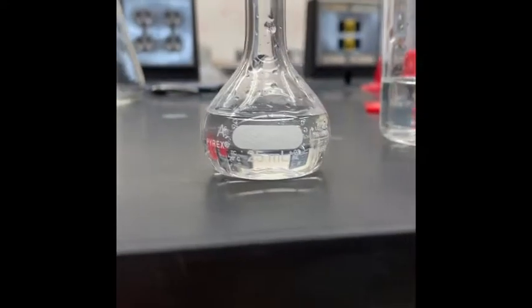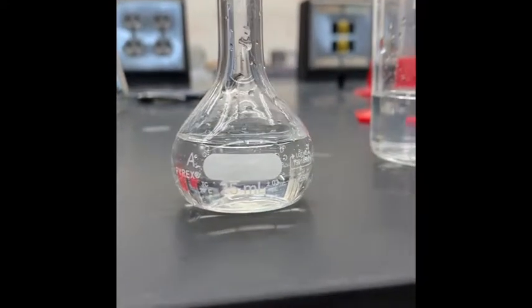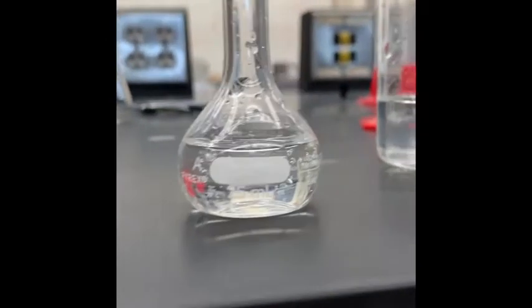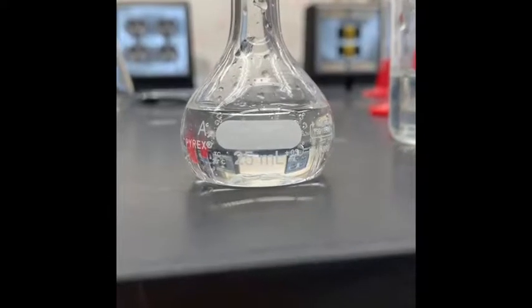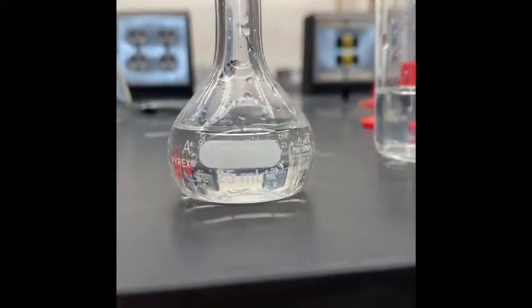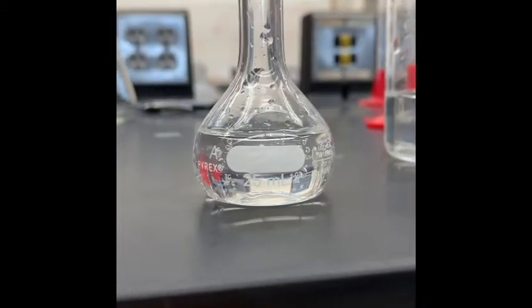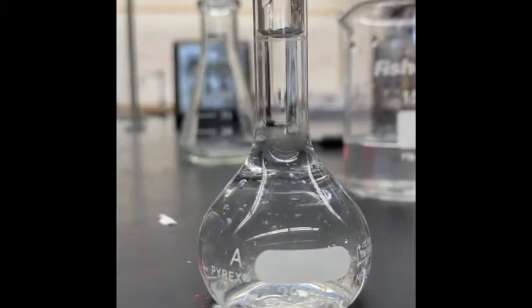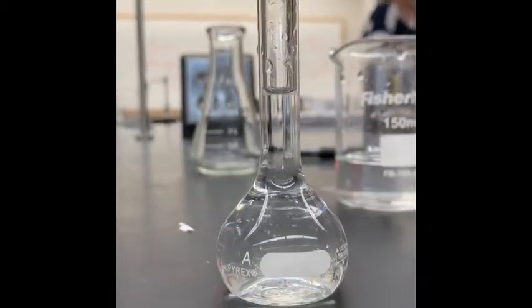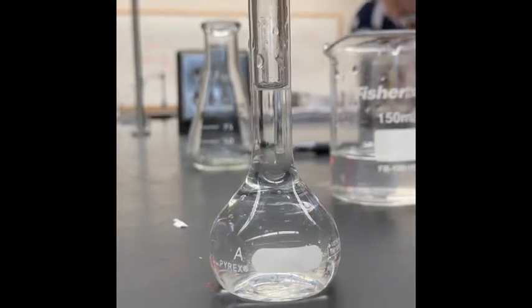This is a 25 milliliter flask with the 20% stock solution in it. And we're trying to find the 10% dilution, so we're going to fill in the rest, which is just 12.5 milliliters, with water to dilute it. Here is the flask with 25 milliliters of the dilution. We're going to repeat this 3 times with the other values that I'll show you in the equations.